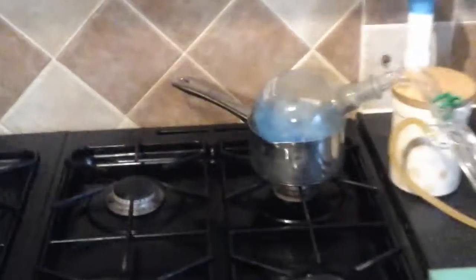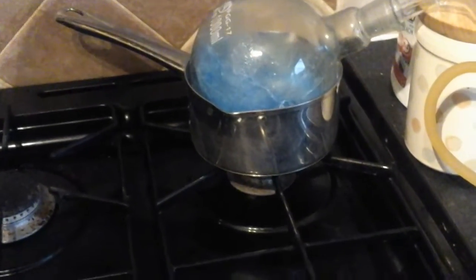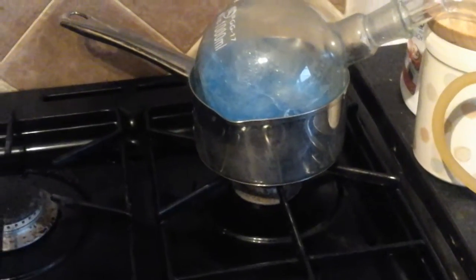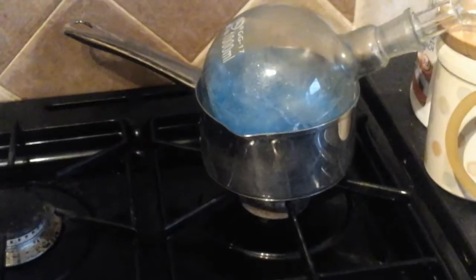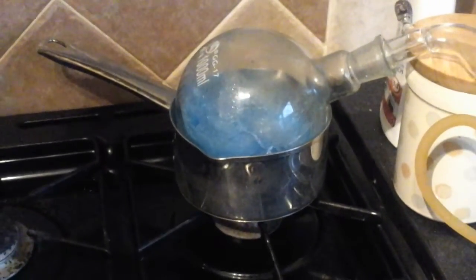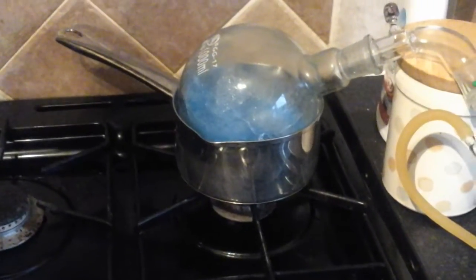So I got myself a little still and this is how it works. At this end I have a pan of water over a burner. This allows for horribly imprecise temperature control. At its lowest setting the water in the pan boils, so the dichloro is certainly far too hot, but that's as low as it will go, so you have to turn it on when it needs it and off when it starts to boil.